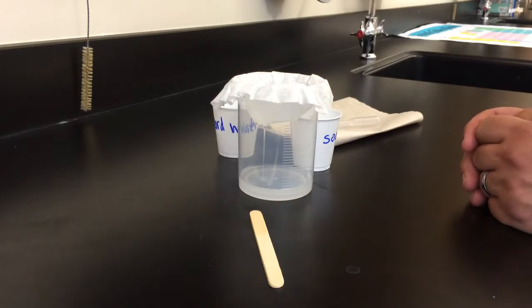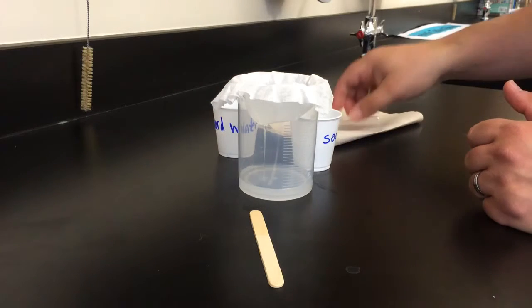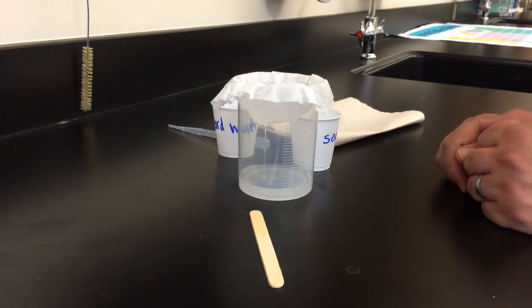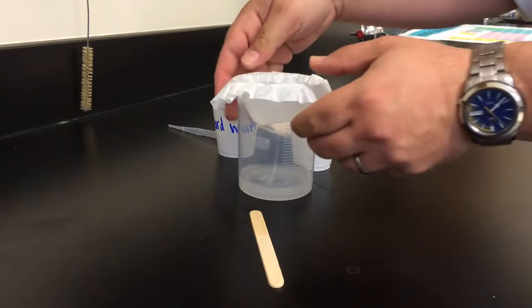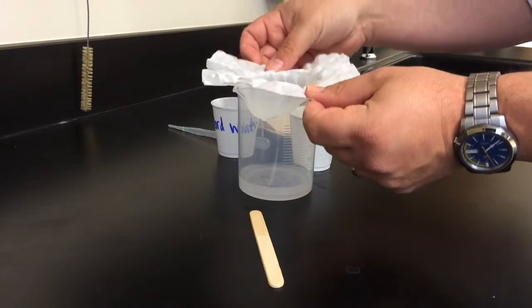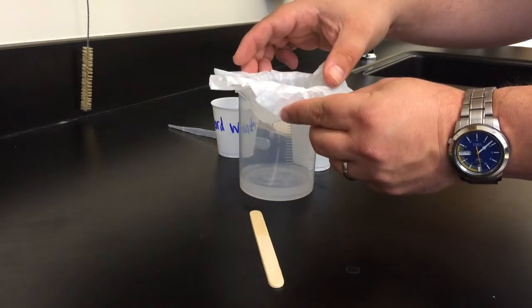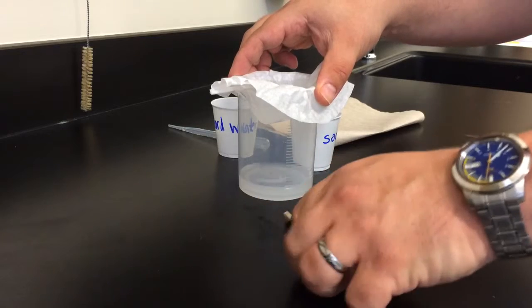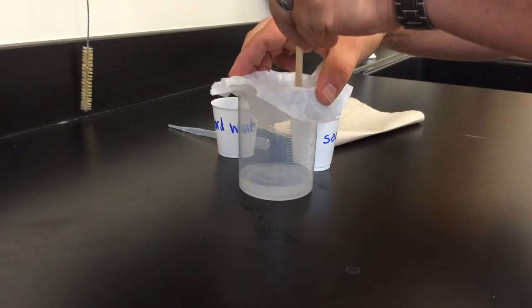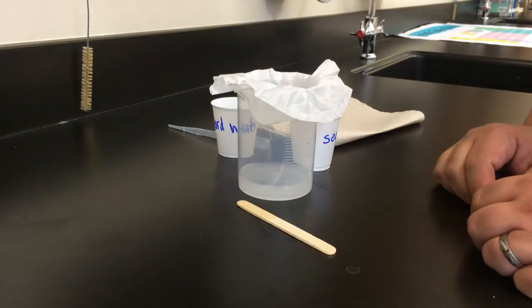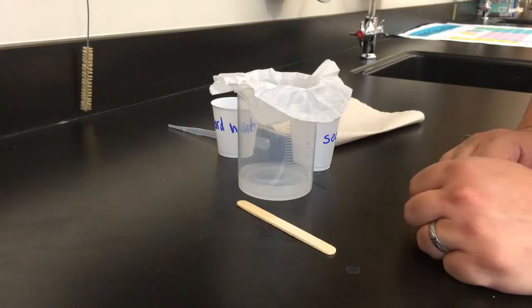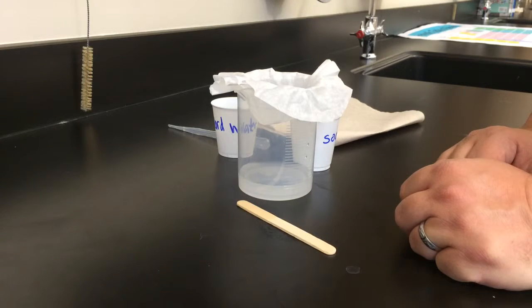So let that happen for a few seconds more. Let the liquid pour through, let the solid collect. Liquid move its way through the filter. You want to get as much water as possible out of the filter so that what's left in the filter will all be soap scum. That's the idea.